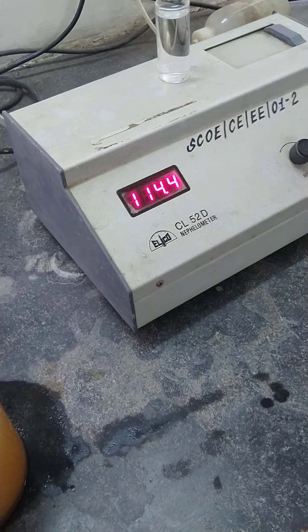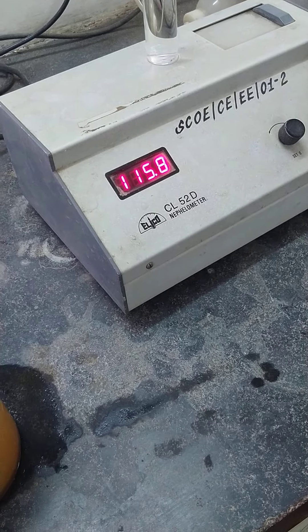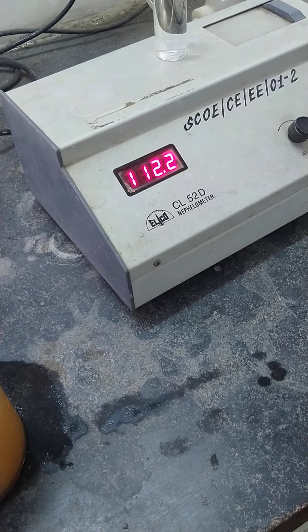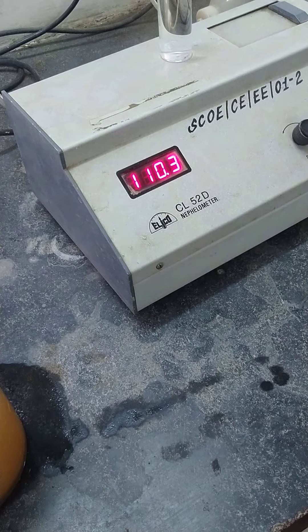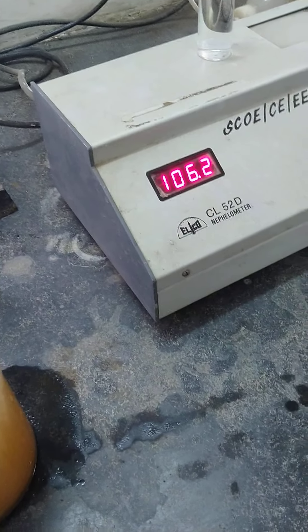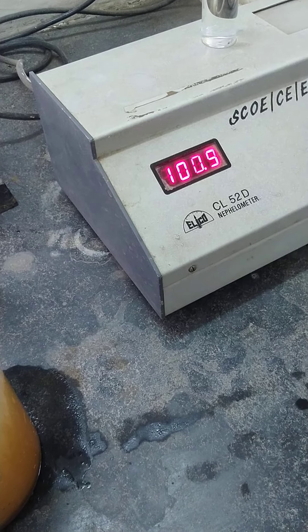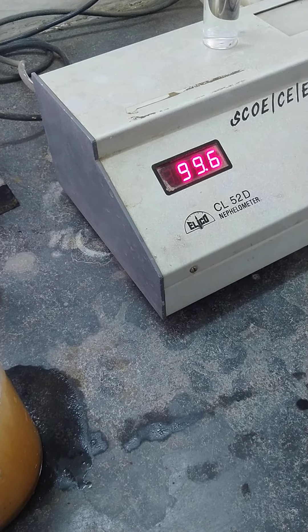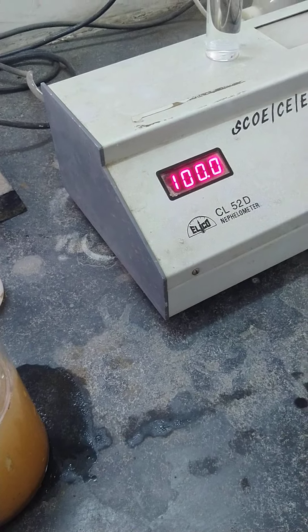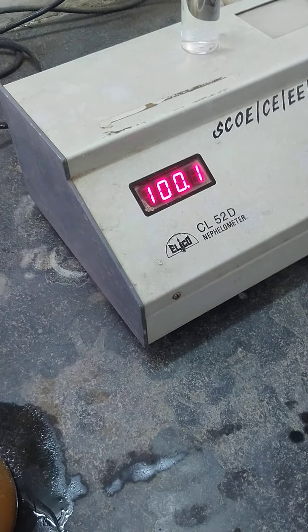We adjust it to 100 with fine adjustment. So zero and 100 — we have calibrated the instrument.